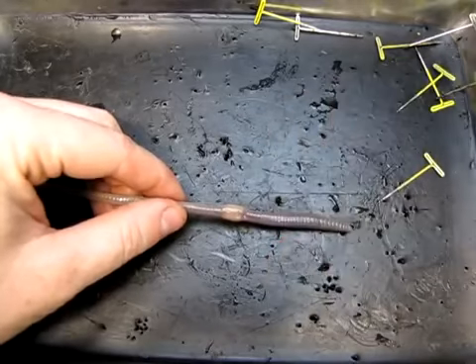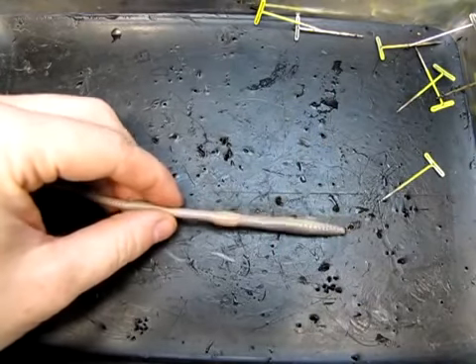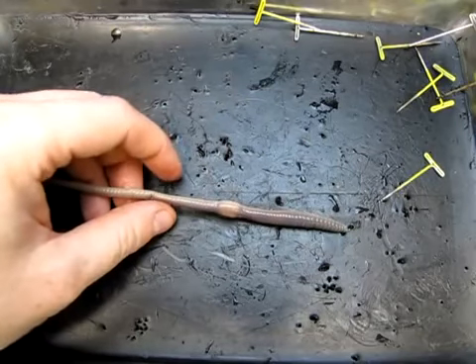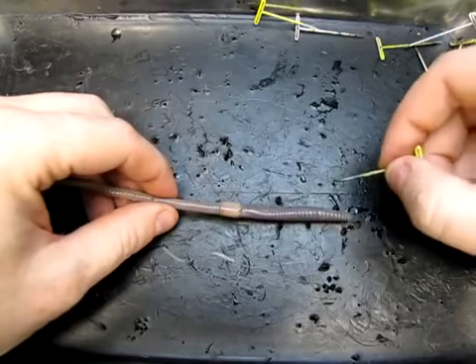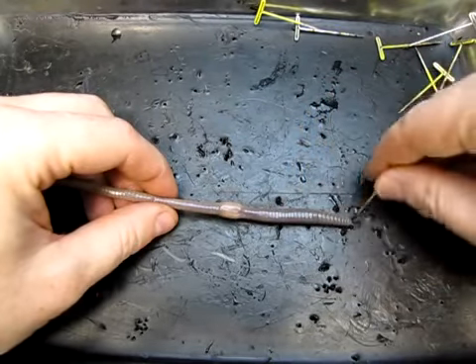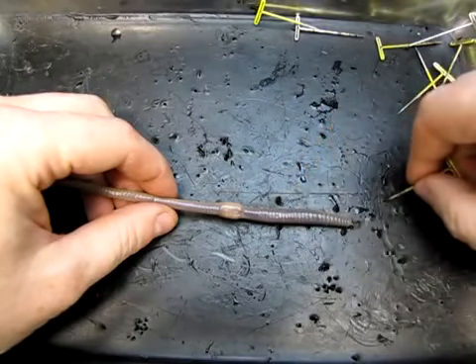Let's start by having a quick look at the external anatomy of the earthworm. The earthworm is an animal in the phylum Annelida, which means little rings. Little rings, if you think of a ring, it's a circular object, refers to the segments that we find on animals in this phylum. So this is the first time that we see true segmentation in the body plan.